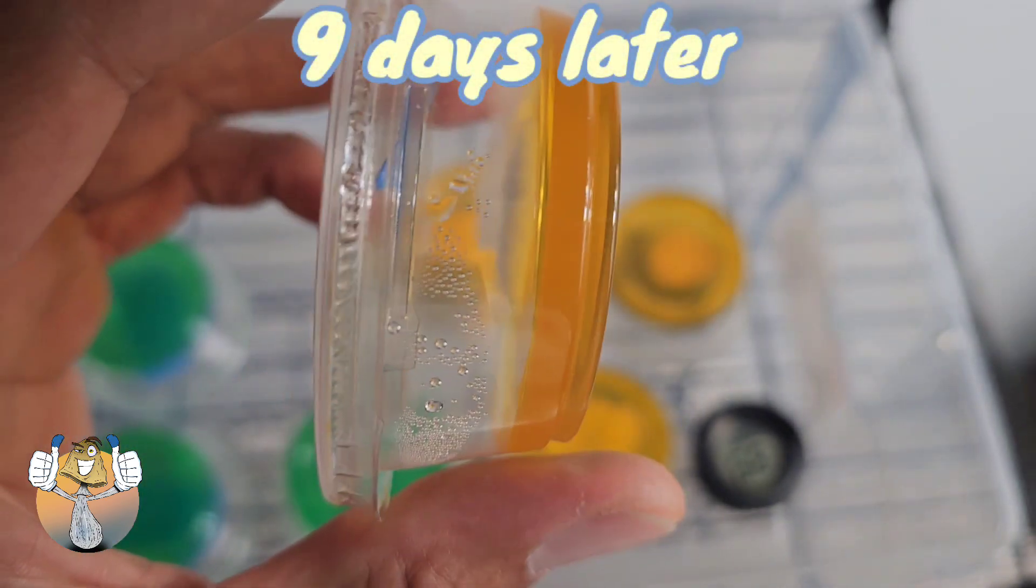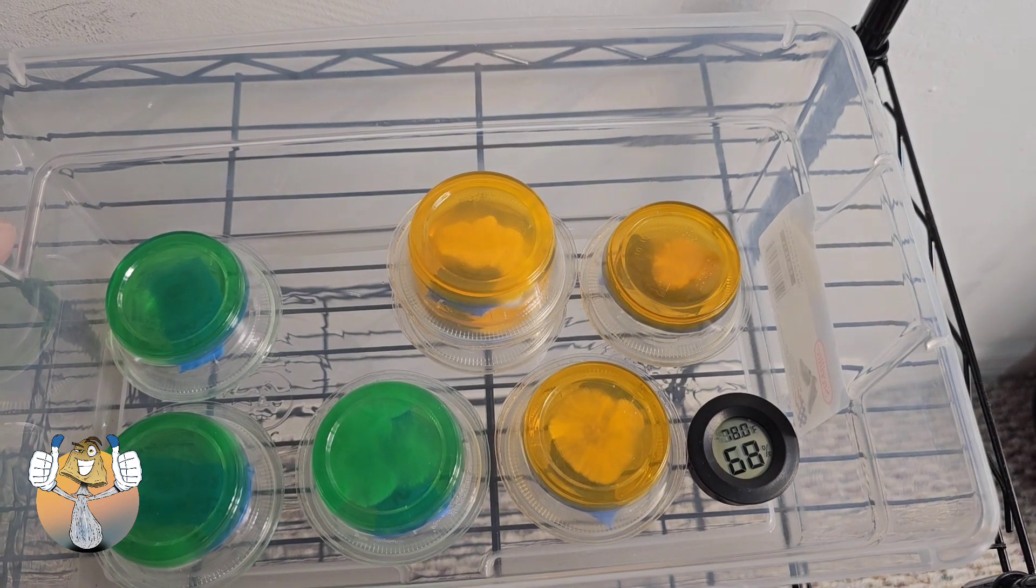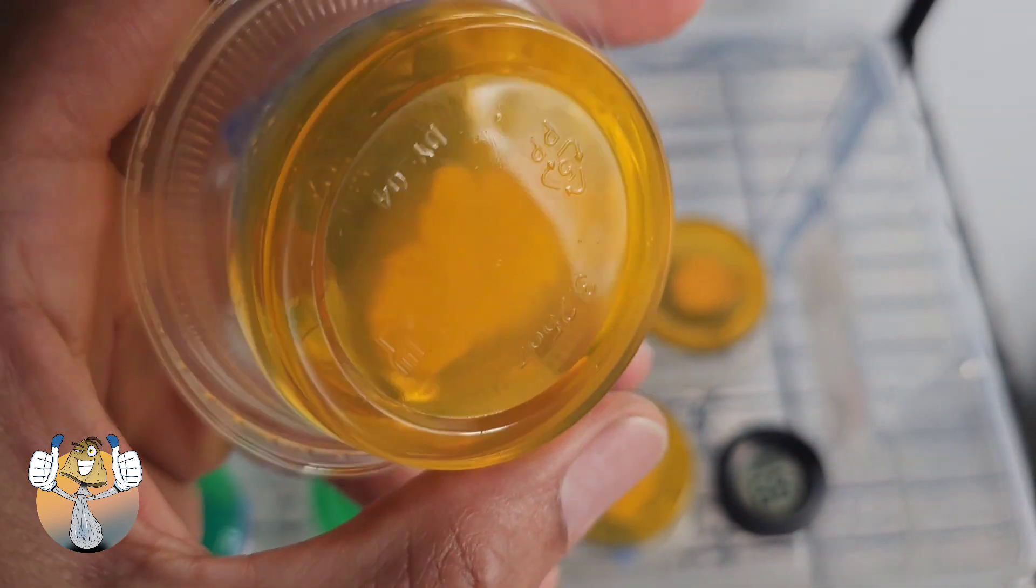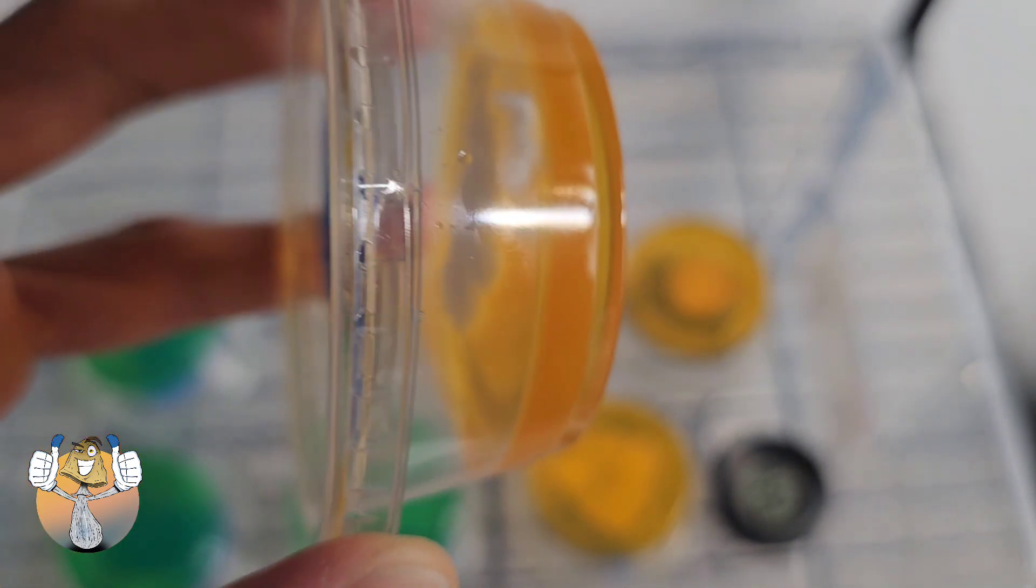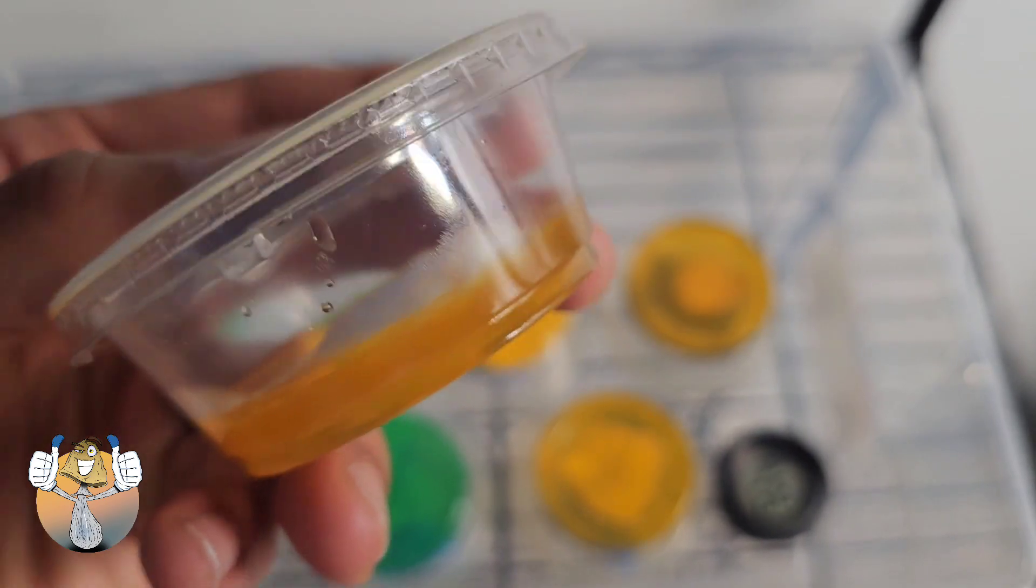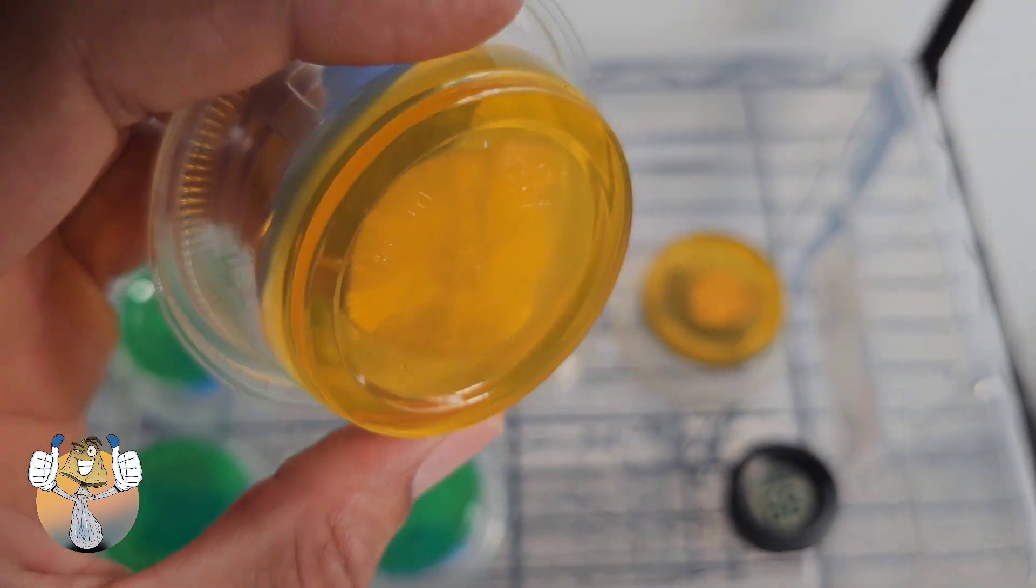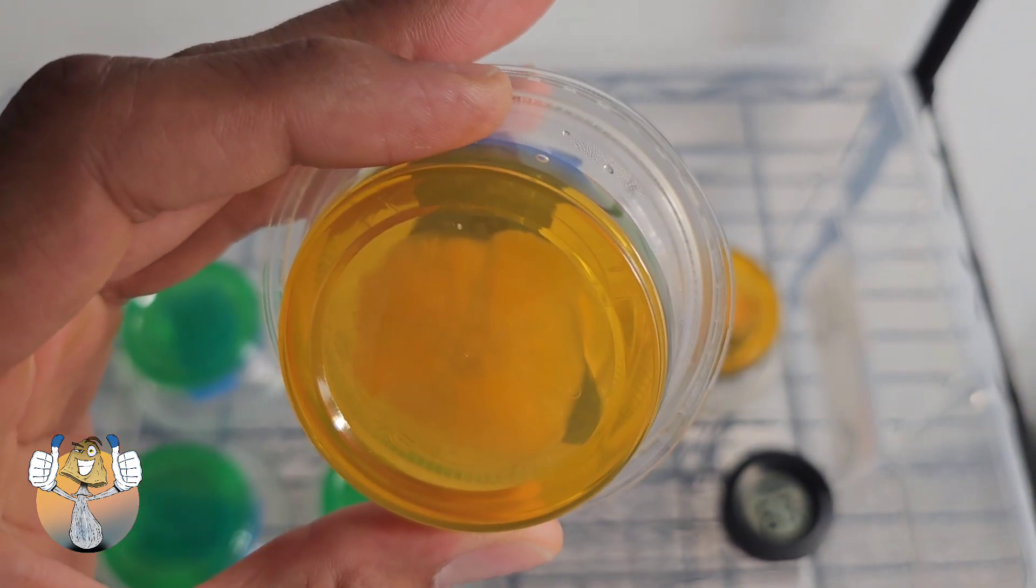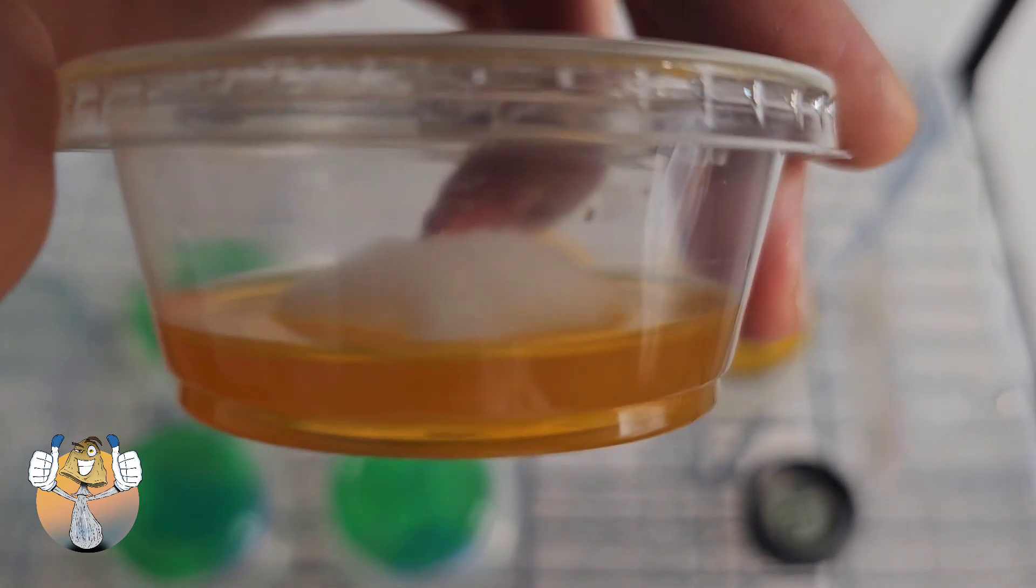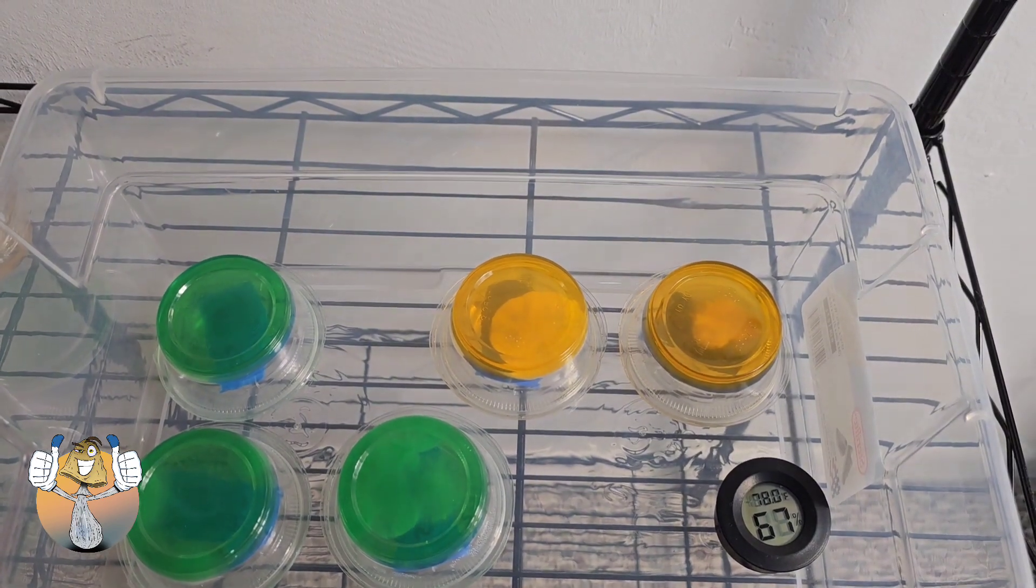So this right here is nine days later and we're still looking nice and well. All these babies looking good. Look at that yellow. I love that yellow agar, looks so nice. Yellow is my favorite color anyways, but that looks so nice. Man, look at that. It's almost the whole bottom. That's going to be nice. We're going to definitely use that one. Everything's getting used, but I'm taking notes. I feel like a mad scientist.